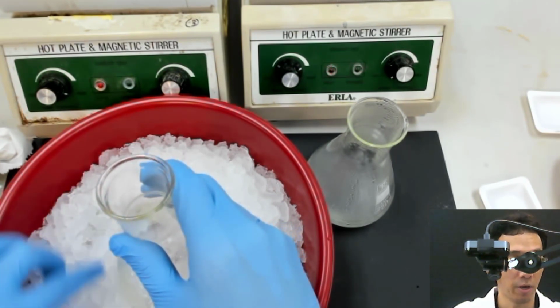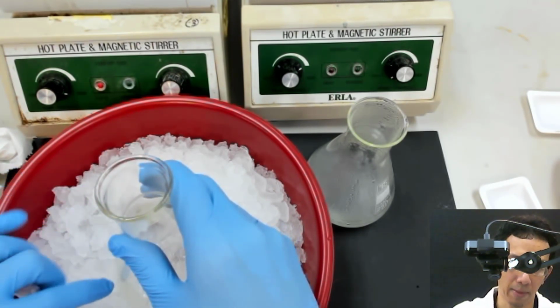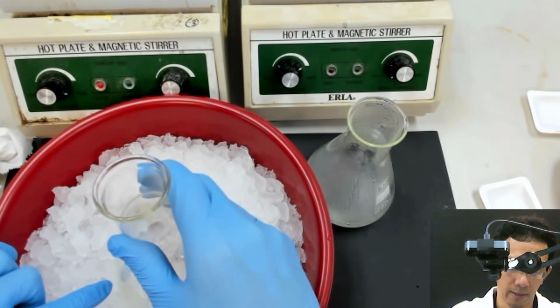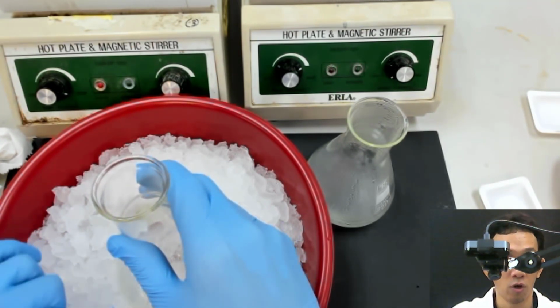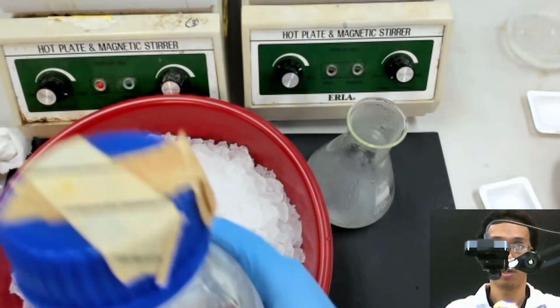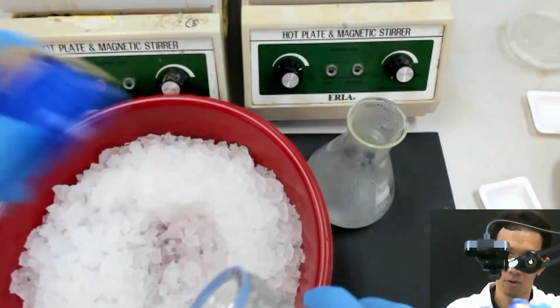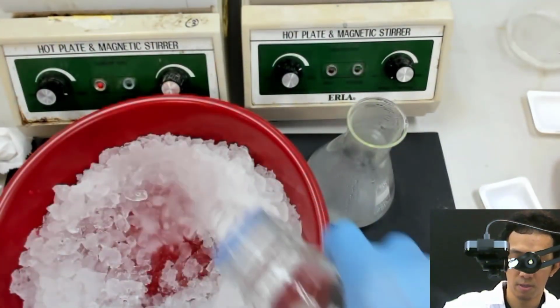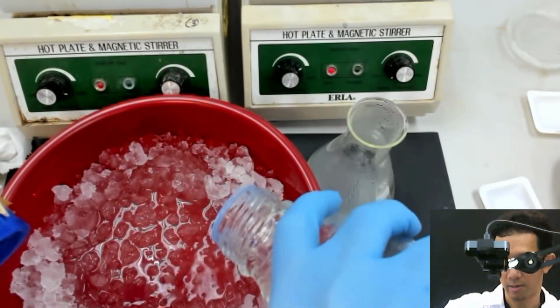You need the water to increase the contact between the flask surface and the cold medium. So I have this water, and I just pour it in.